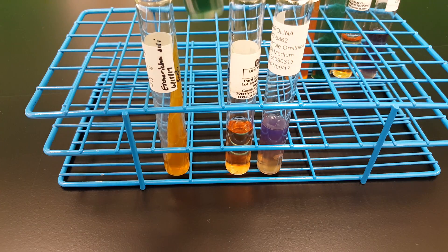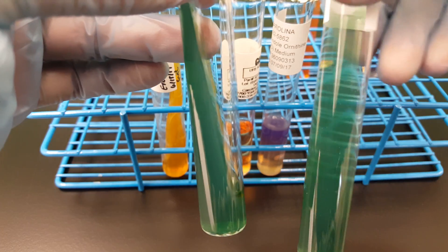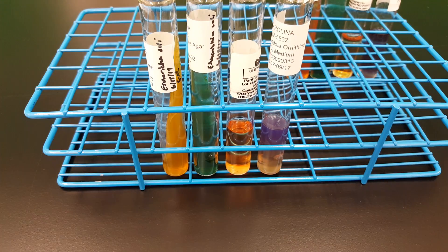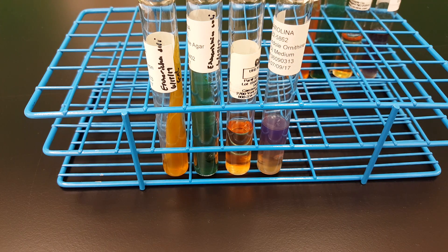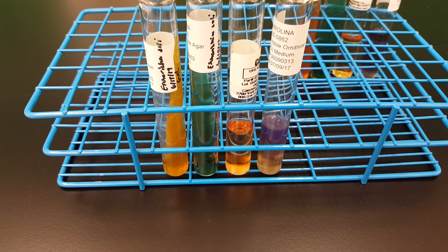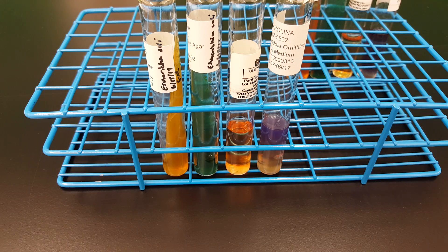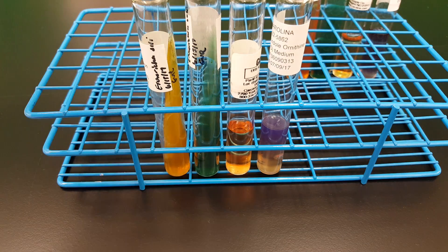Moving on to the citrate slant, we have the original citrate slant here — it's green, and this one has stayed green, indicating a negative result. A negative citrate result indicates that E. coli does not utilize citrate as the sole source of nitrogen and carbon in order to grow on the media. So there is no alkaline reaction and it keeps the agar neutral, which keeps it green.